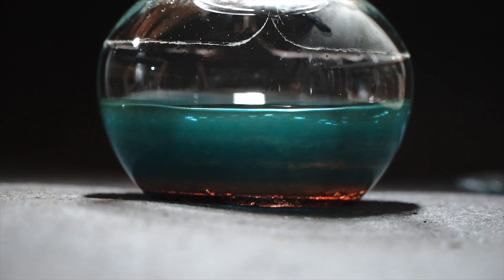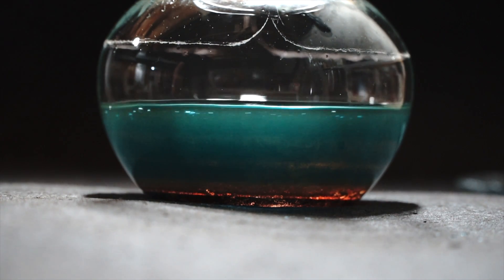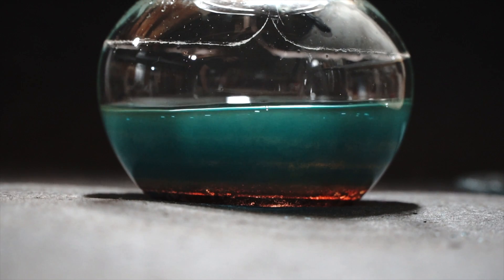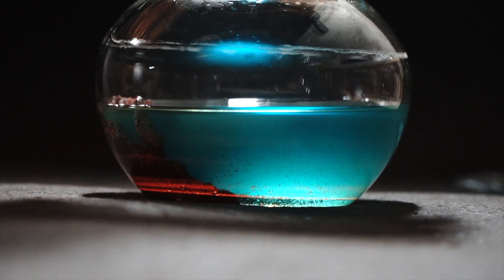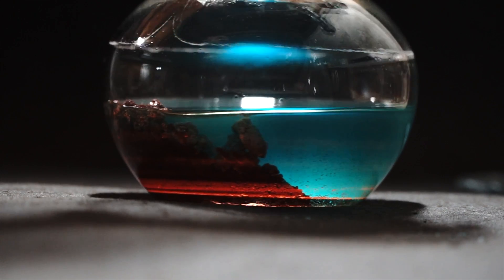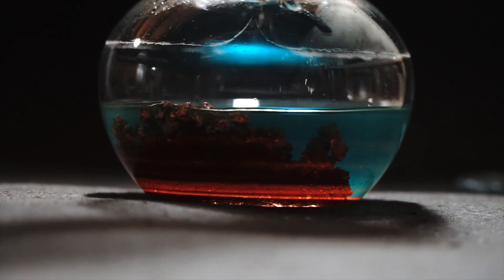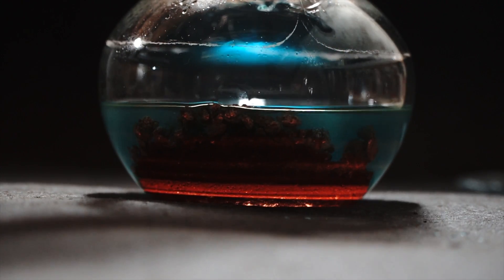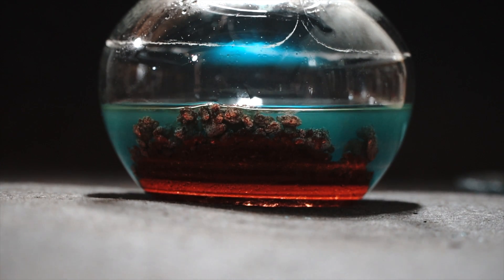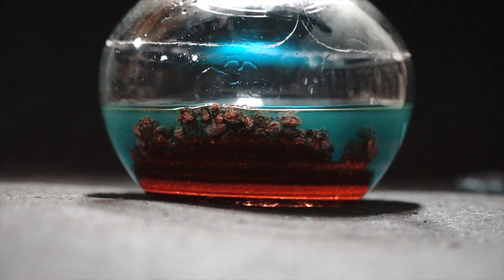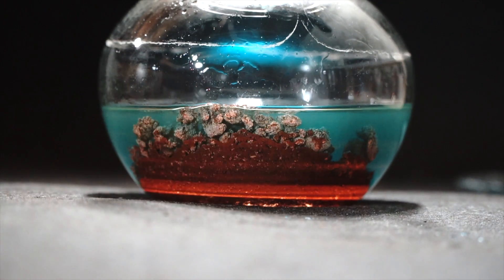It almost looks like gold right here. Now if you notice, the liquid is still kind of bluish, which means there's still copper sulfate dissolved in the liquid, as well as some other impurities dissolved in there. I wanted to have excess solution so that way all of the zinc metal would react and turn to copper.